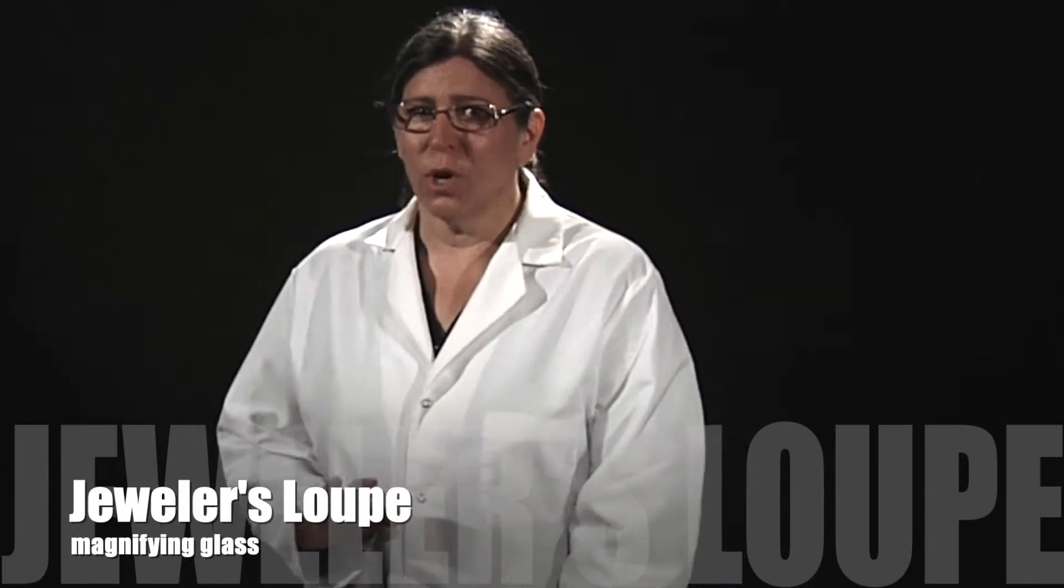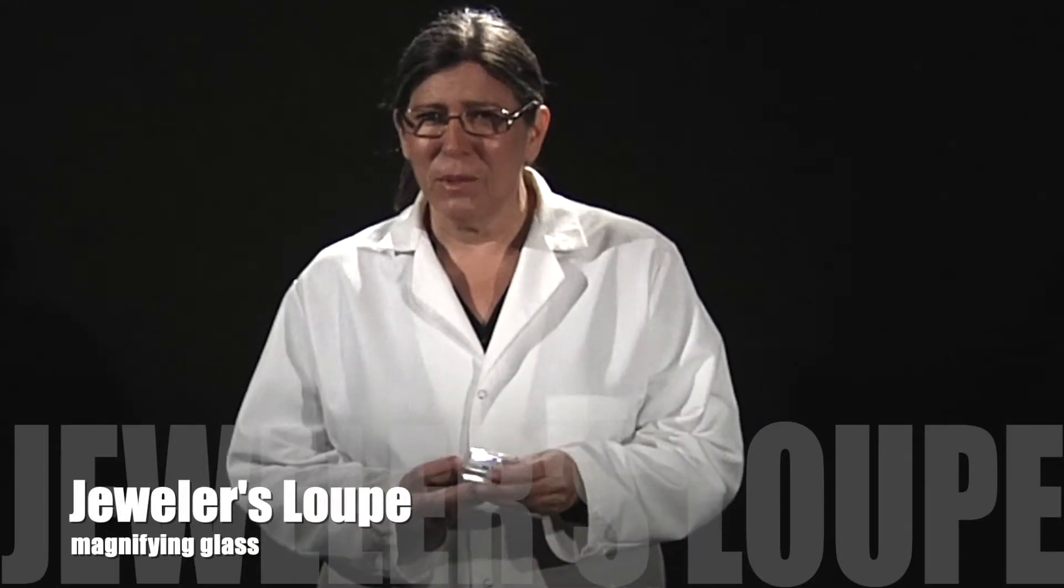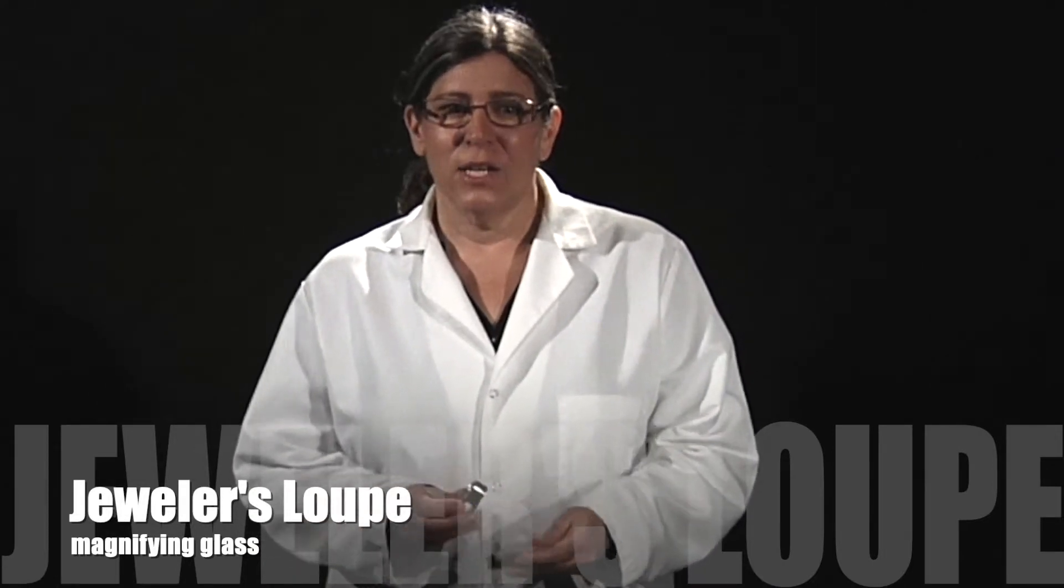The jeweler's loupes are basically just little magnifying glasses and in biology we tend to use a dissecting microscope in the classroom, but for this we're not really going to be dissecting anything this semester but we are going to be needing to look at some things fairly close up.